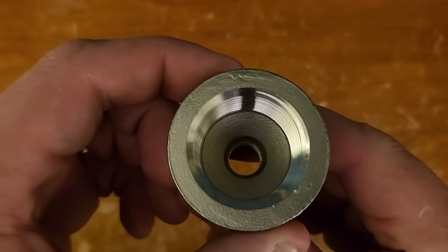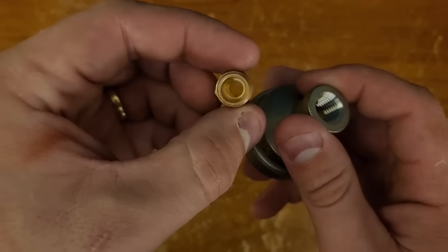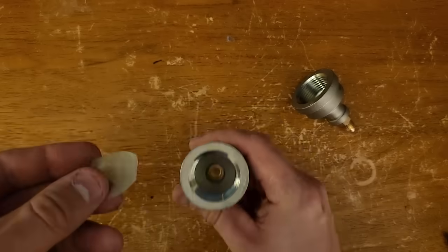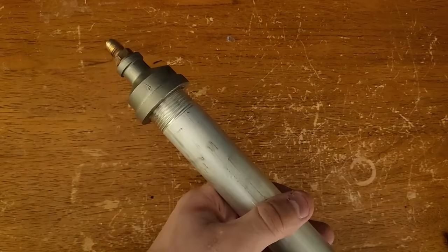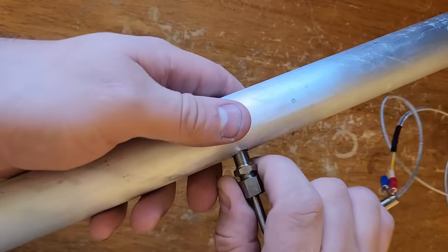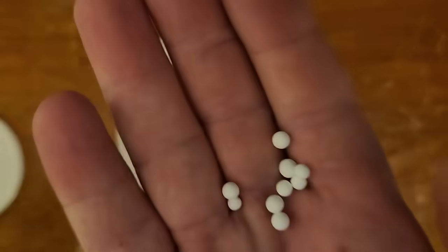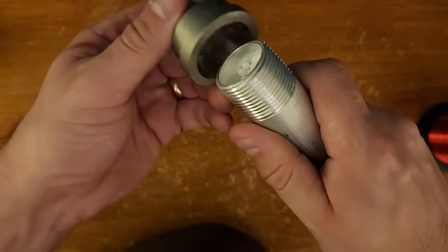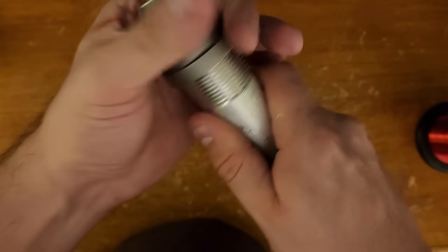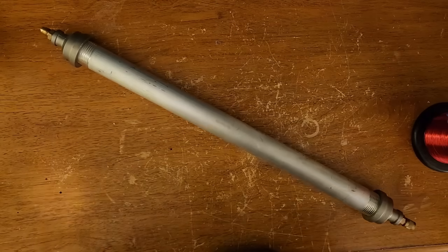Next, I make the fittings for the catalyst pipe. These are one inch NPT to one quarter inch reducers, with one quarter inch NPT to one quarter inch flare fittings on the ends. I also added some stainless steel screen mesh to keep chunks of catalyst from flying out. The adapters are screwed onto an aluminum pipe, and the pipe is drilled and tapped in the middle with a one eighth NPT thread to accept a thermocouple. I pour the catalyst — aluminum oxide in the form of three to four millimeter balls — into the pipe and close everything up. There's no thread sealant on any of these joints because it would probably just burn off at the temperatures involved. However, the pressures are never going to be more than a couple psi, so a tight fit should be enough to form a decent seal.